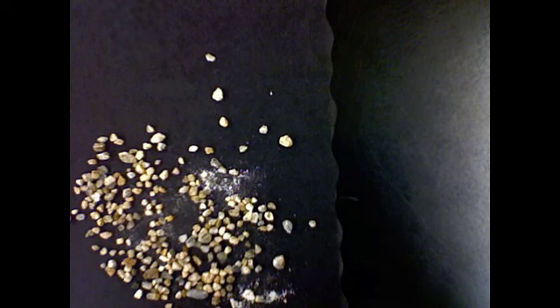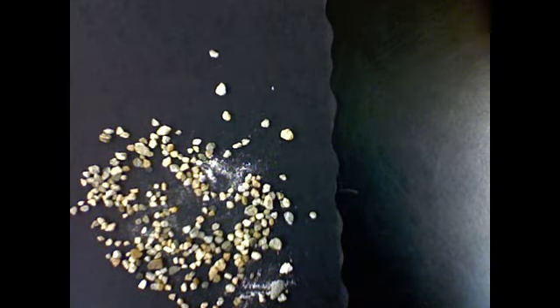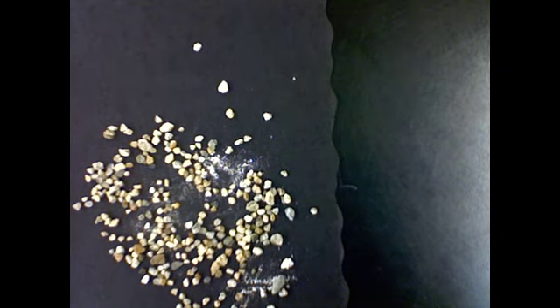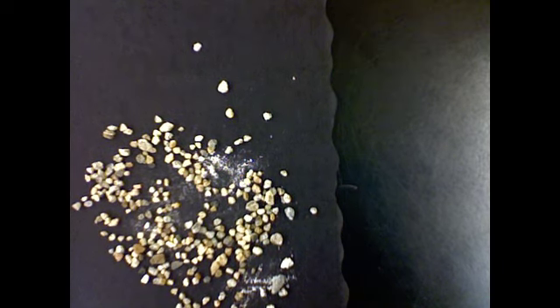Anything else that you think is worth noting besides the fact that it looks like there's some very powdery pieces of gravel substance in there? Well, let's see. Does it bounce? Guess not. When you're exploring properties, you're trying to find out as many different things about an object as you can. So if we had a bigger lab and more complicated instruments, we could choose to weigh gravel.